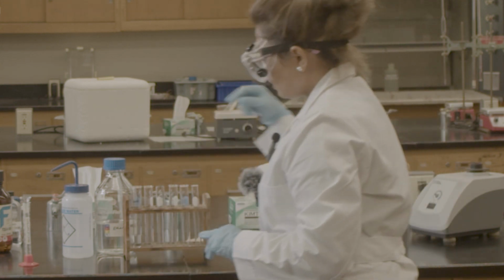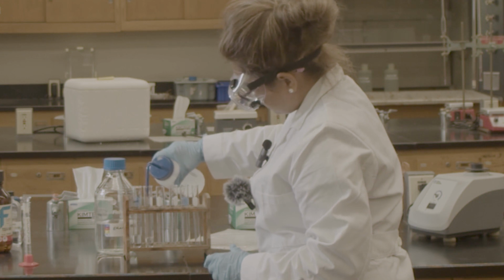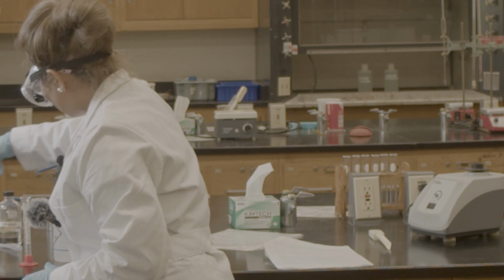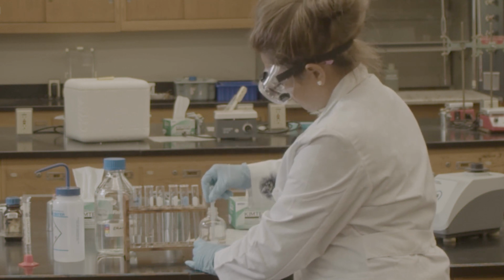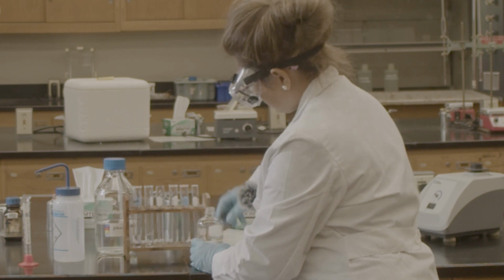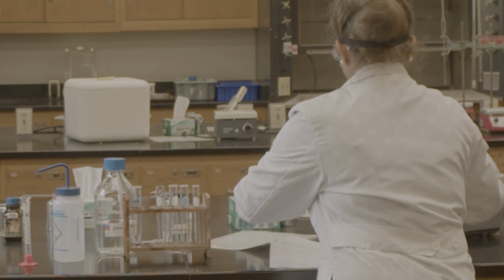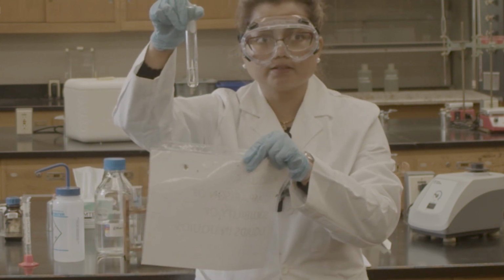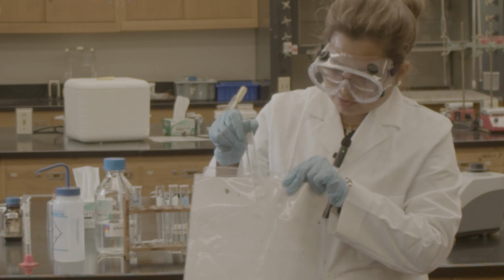Now I'm trying to do the water with the chloroform. I'm not expecting it to be miscible because they are not making any hydrogen bond. So, chloroform. I need another background. I don't think they can see the layer. Can you see the layer? Oh, so there is water and the chloroform.